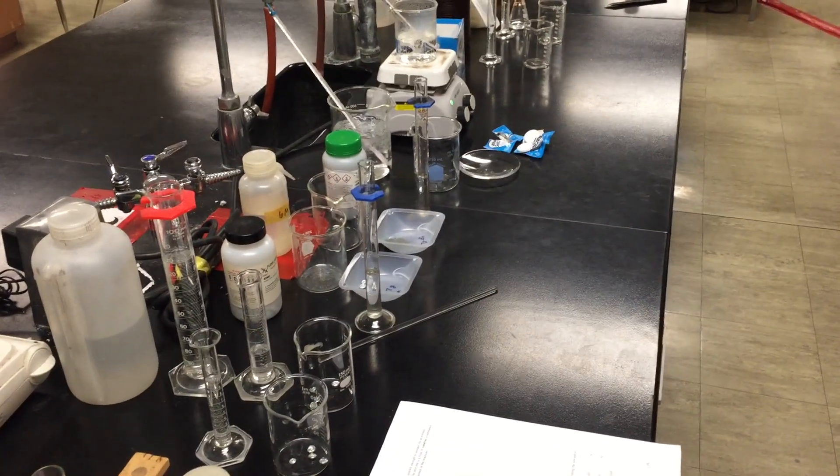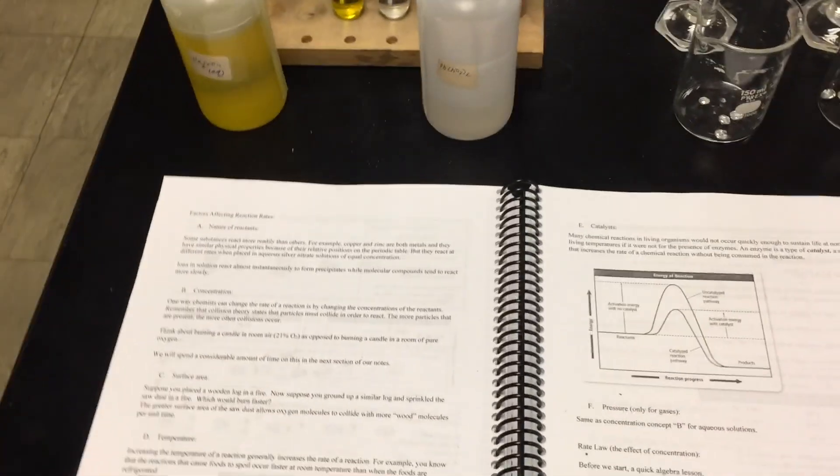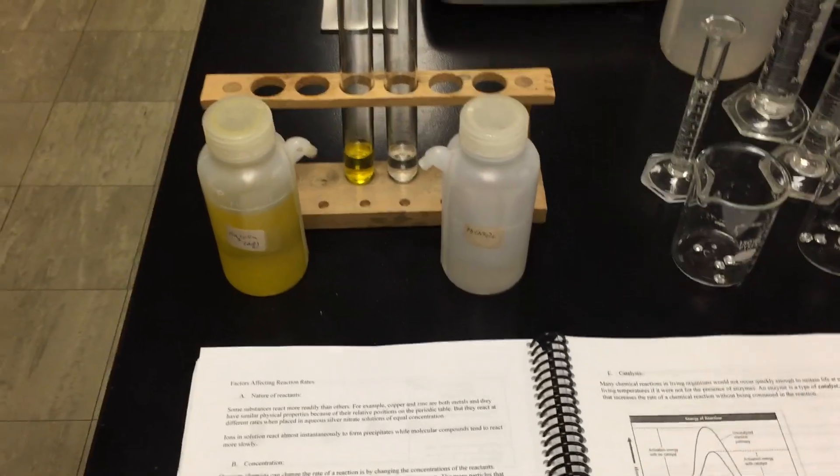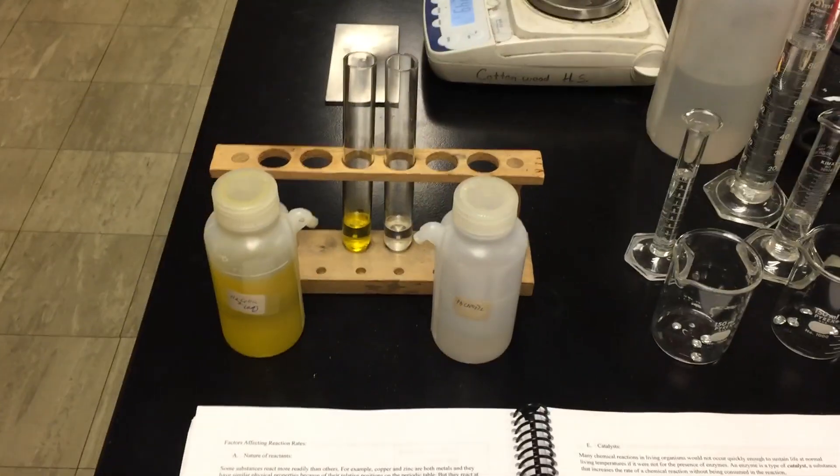Hey kiddos, we're going to do a few demonstrations today as you can see. We're going to talk about factors that affect the rate of a chemical reaction, and we're going to do these in the same order that we have them in your notes.